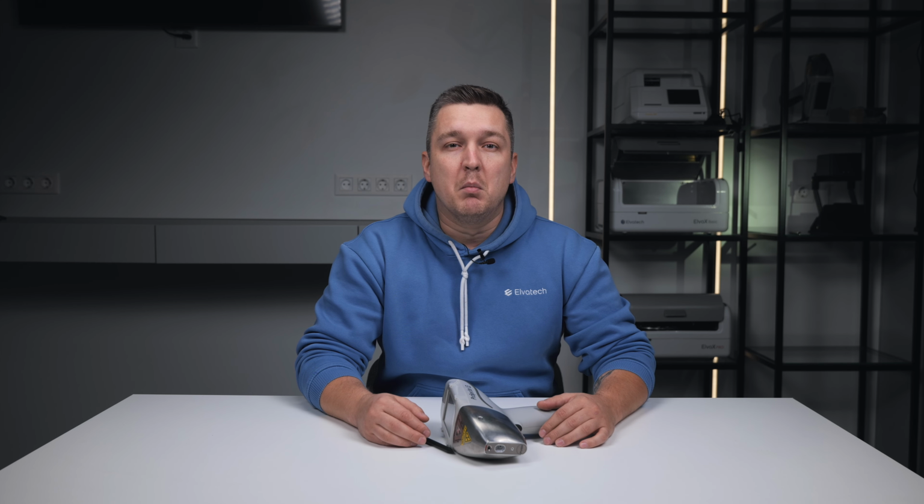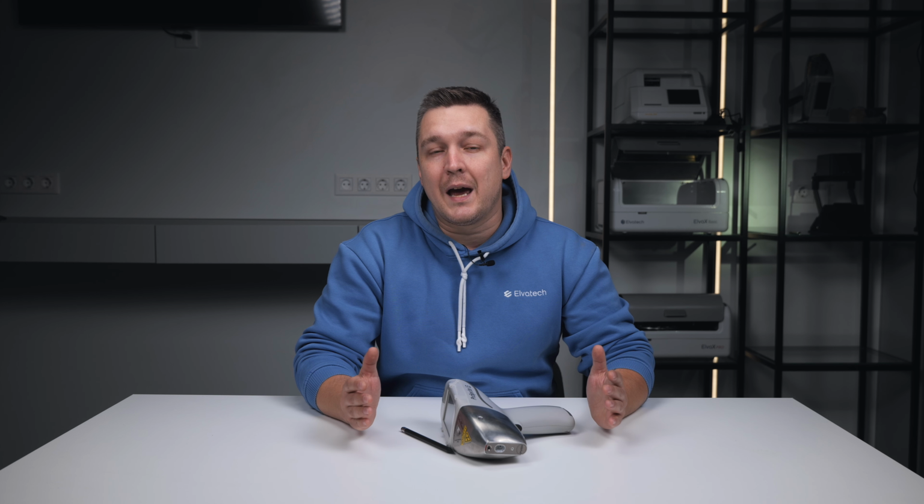And now let's talk about where alloy grade is most useful. Alloy grade is the mode that saves you seconds on each measurement and hours of work in total. Most often it is used in scrap yards when you need to quickly separate stainless steels, alloyed steels and non-ferrous alloys. When sorting metal stock so you don't mix visually similar alloys. In production for quick checks that the marked grade on the tag matches the actual material.